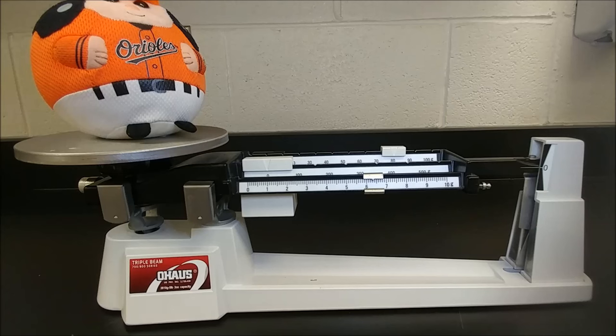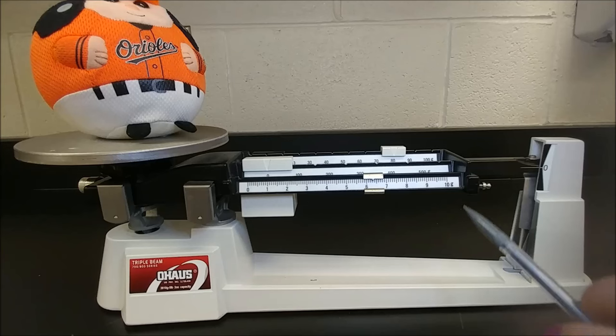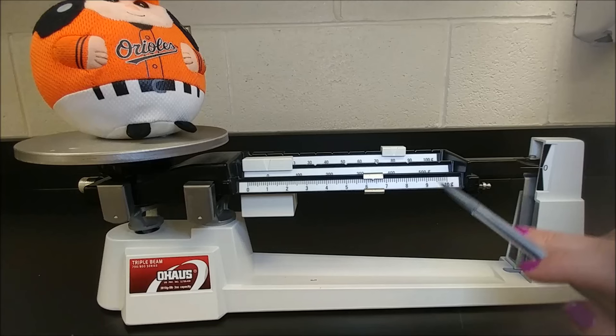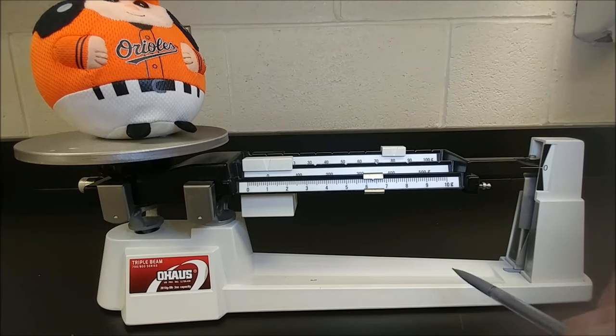That is how to use a triple beam balance. If you ever forget what unit it is in, it should be written on your triple beam balance. Notice each arm has grams because this one measures in grams. It's got that little G there, and grams is always used for mass.